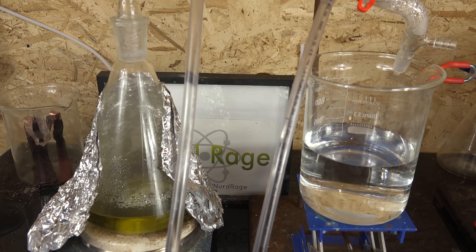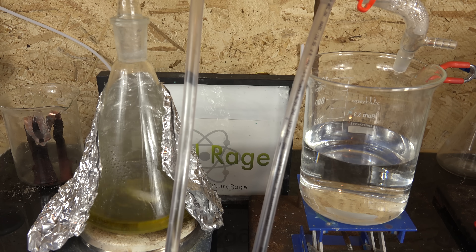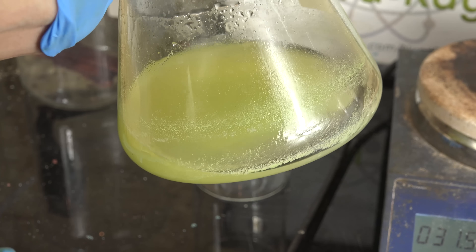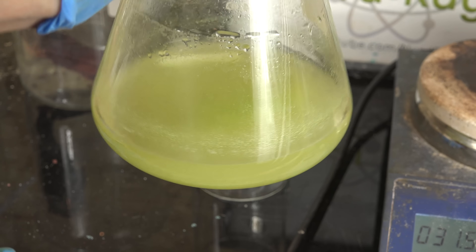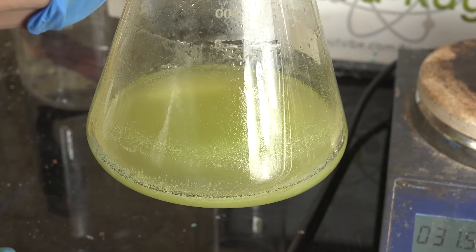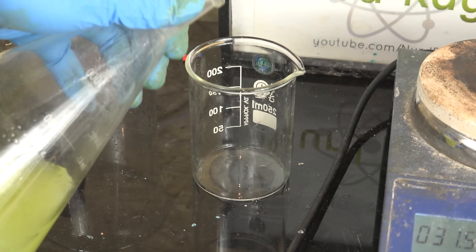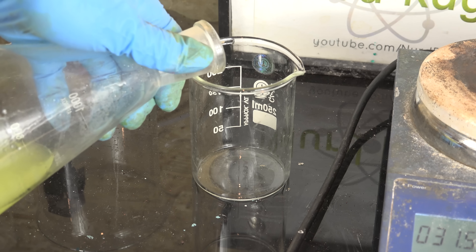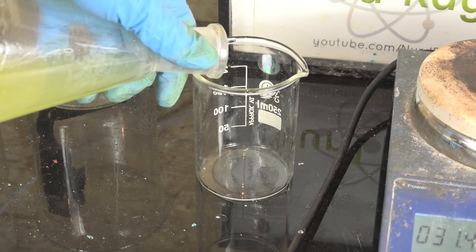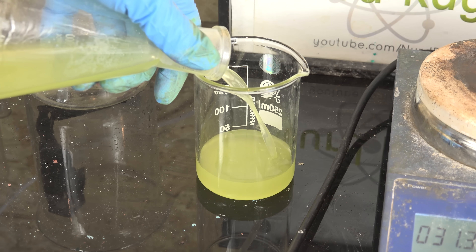Once the residue starts misting like this, then most of the water has been removed and you have fairly concentrated sulfuric acid. Turn off the heating and let it cool. And here is our recovered sulfuric acid — you can reuse it for more copper recovery from copper nitrate wastes. Don't worry if it has leftover copper sulfate; that will feed forward into our next run. But it will accumulate contaminant metals like iron, nickel and zinc until it's more metal sulfate than sulfuric acid. At that point you'll have to dispose of it. You can recover the base metals from it but that's a very complicated topic for another time.